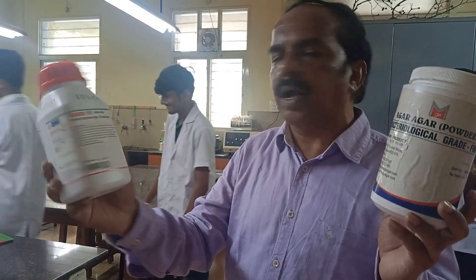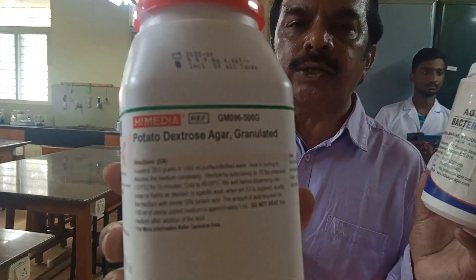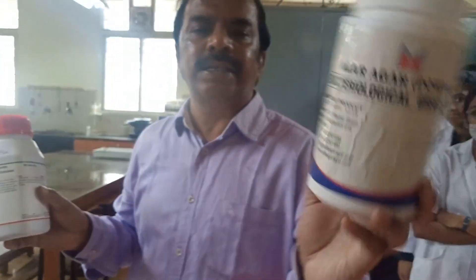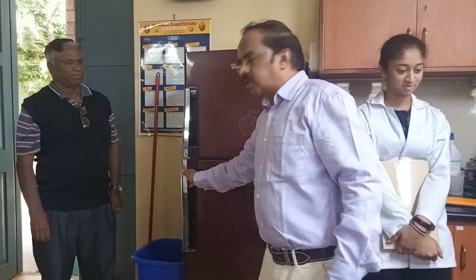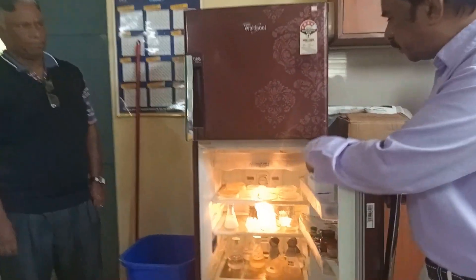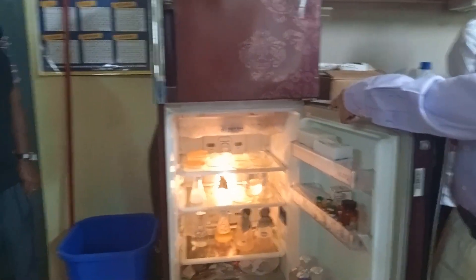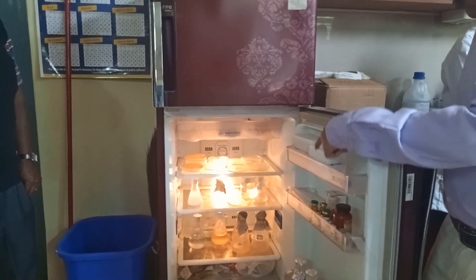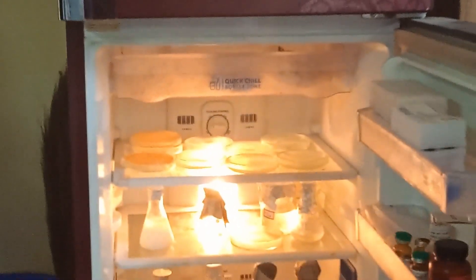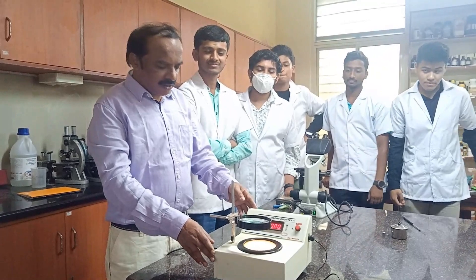Nutrient medium is prepared using agar, the solidifying agent. Agar is extracted from algae. We have two different types of agar here: this one is called potato dextrose agar, and this is bacterial grade agar. We have prepared the nutrient media and we also have some cultures stored inside the refrigerator.